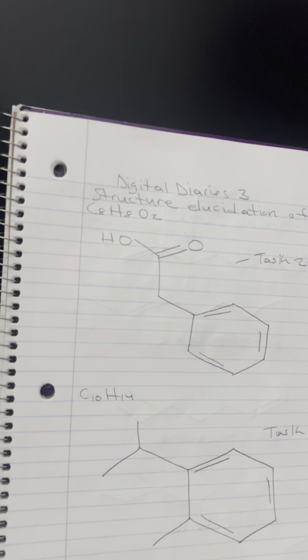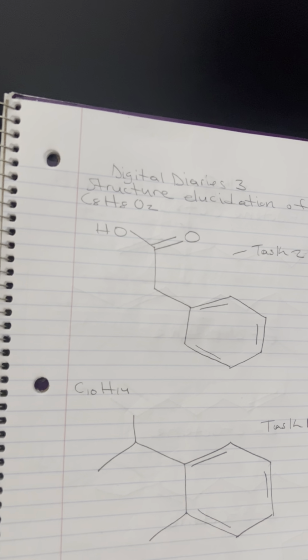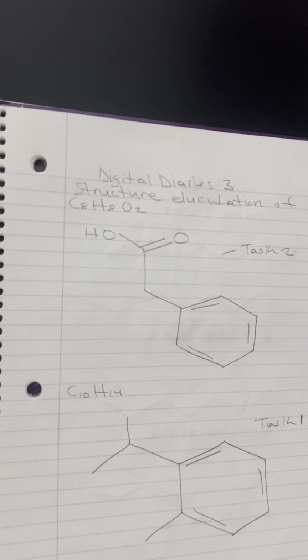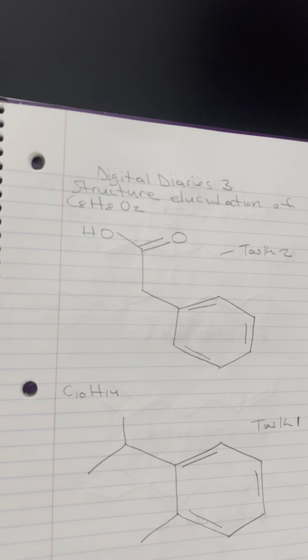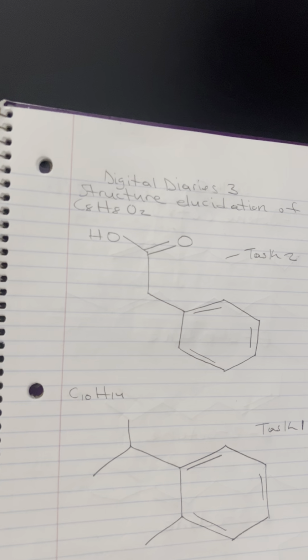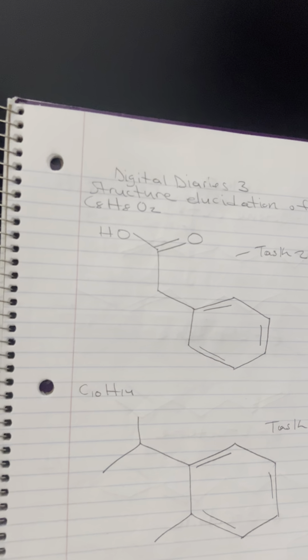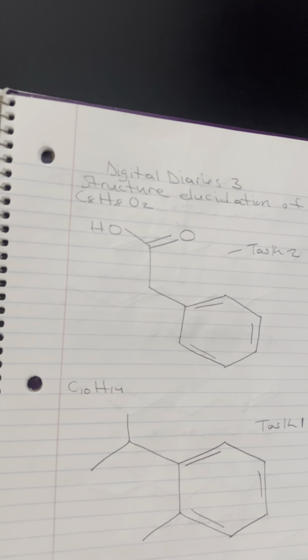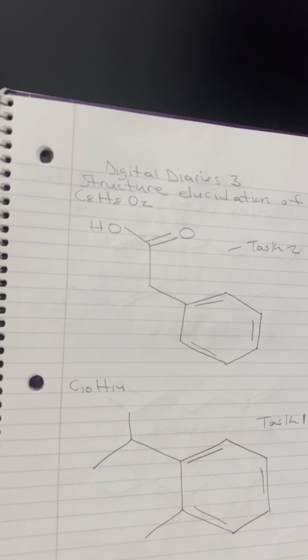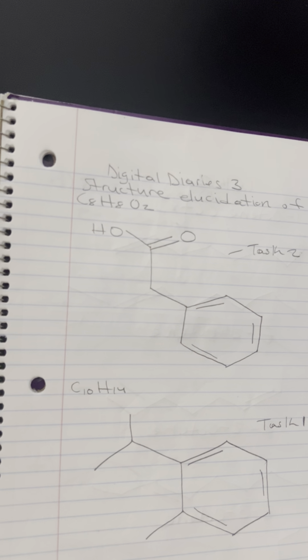Then you have the C=O stretch, which is a sharp peak around 1650 to 1750 cm-1 and indicates a carbonyl group, commonly found in ketones, aldehydes, carboxylic acids, or esters. Then you have a C=C stretch, which is around 1600 cm-1 and could indicate an alkene or aromatic ring. A C-H stretch around 2800 to 3000 cm-1 typically indicates alkanes, while C-H stretches just above 3000 cm-1 suggest alkenes or aromatics.